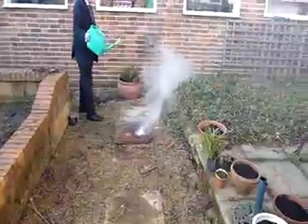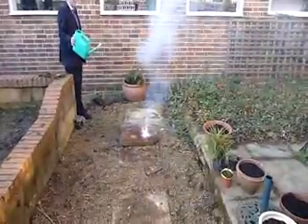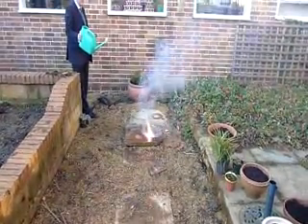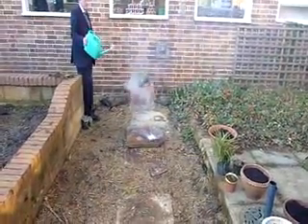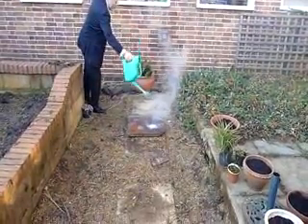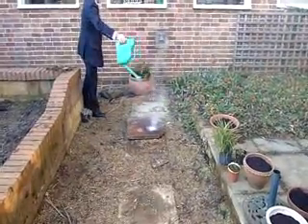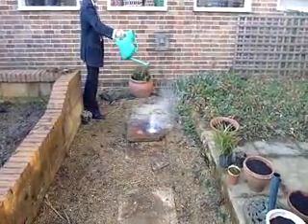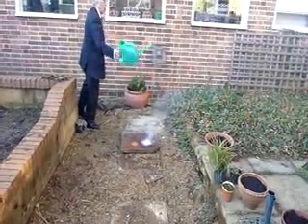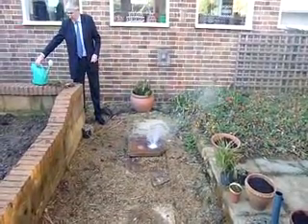Now, basically the magnesium's reacted. Put enough water on it, cool it down, now we put the fire out. But obviously, if you ever come across a magnesium fire, you do not put it out with water. What do you do then? Like that.